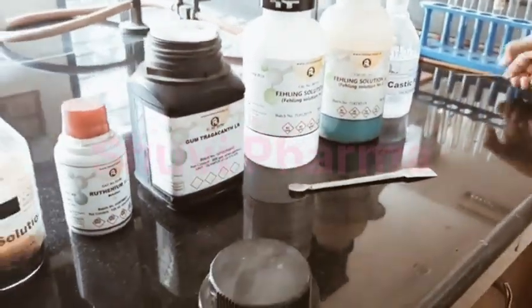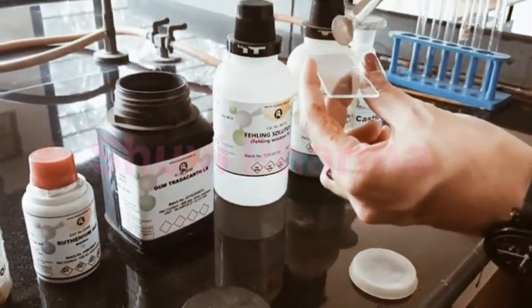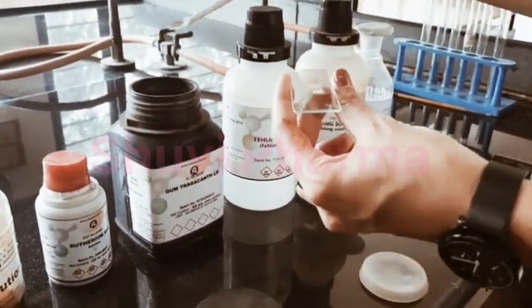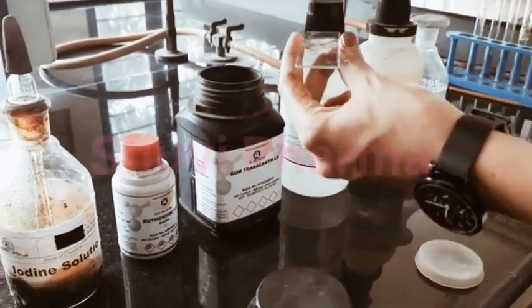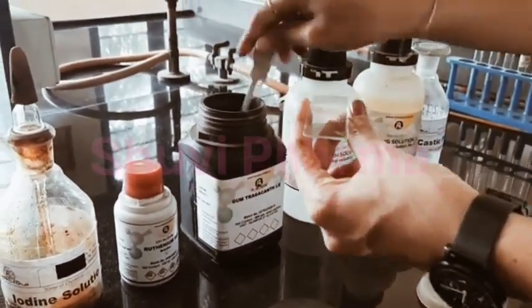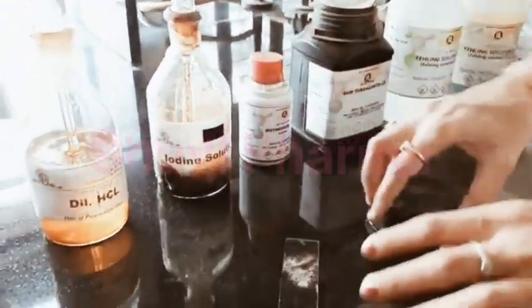Now the next test, for that we require a slide. Over that slide we will spread the tragacanth powder with the help of a spatula. And to this we'll add ruthenium red solution.